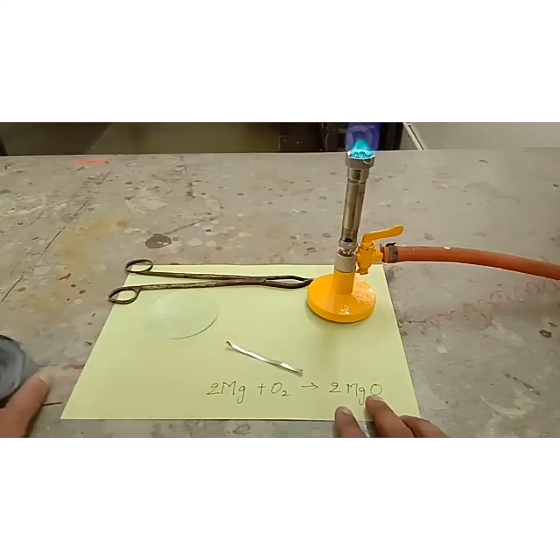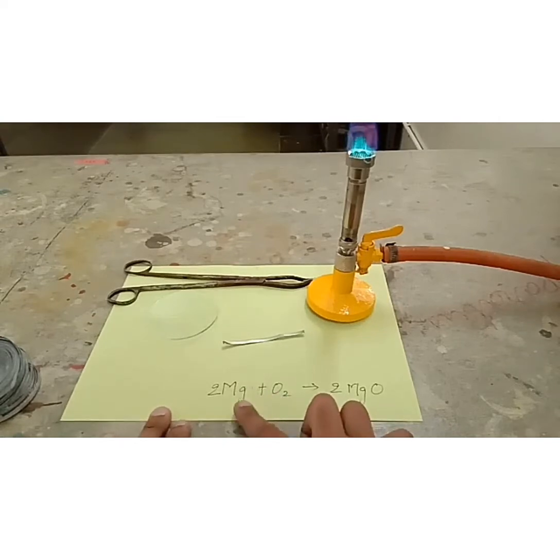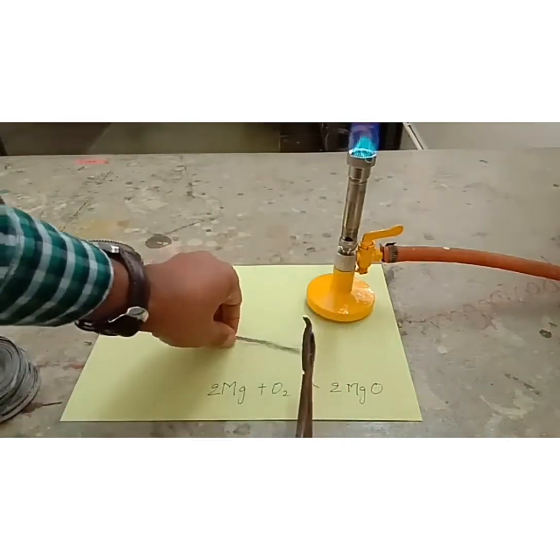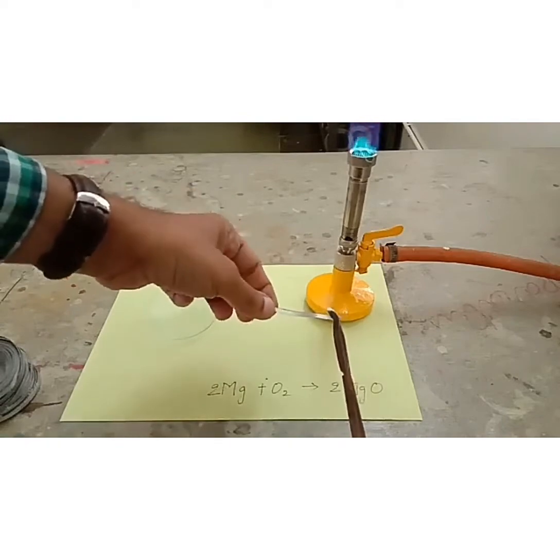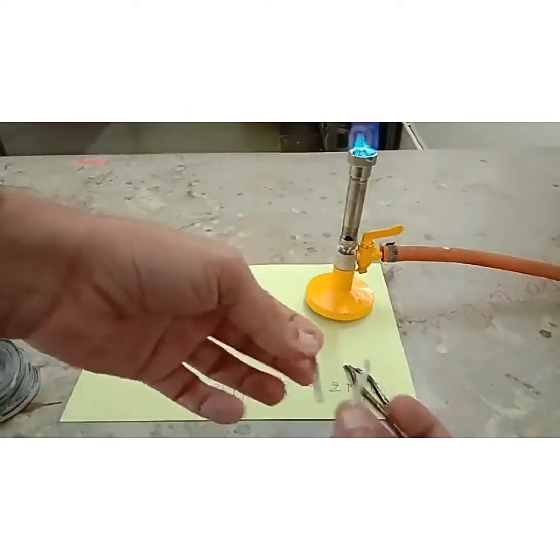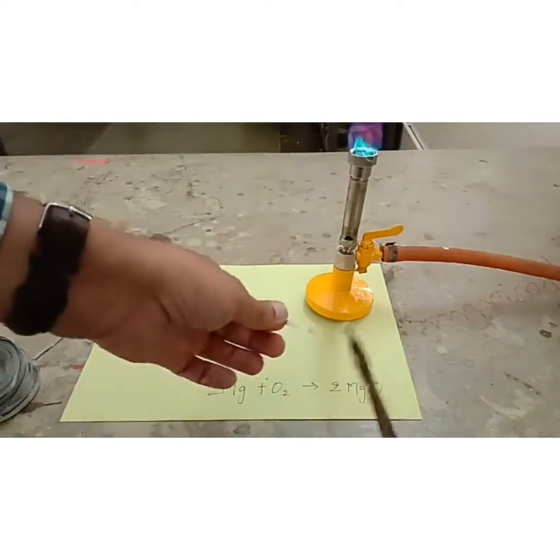So when magnesium reacts with oxygen, it requires heat energy, and after initiating this reaction you will see that the magnesium burns in presence of oxygen to form magnesium oxide, and magnesium burns in oxygen with a brilliant white flame, that is called a dazzling white flame. Very difficult to see that. So let's try the experiment, and here I am going to hold this magnesium ribbon. Actually we don't require a very big piece of magnesium. It's very handy, you can even break it with your own hands. So I choose to put all other things aside.